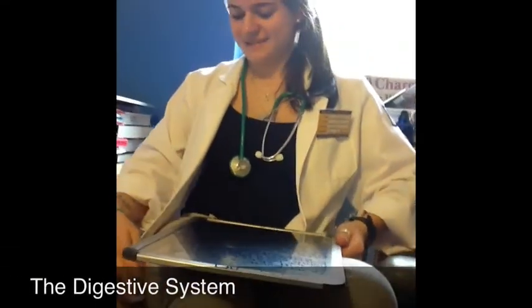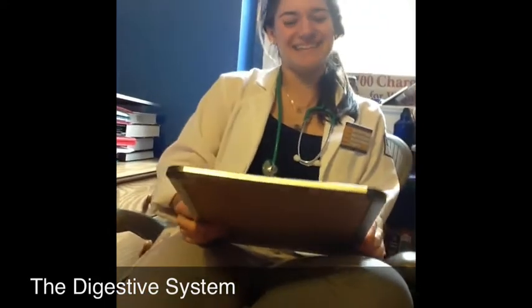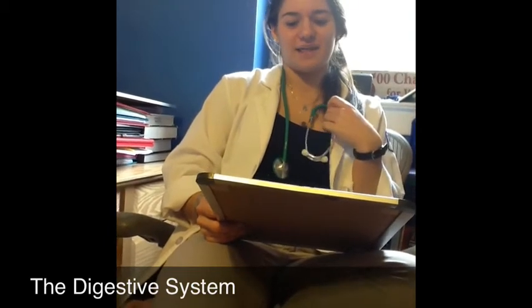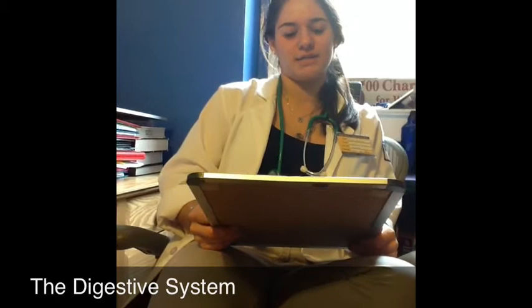Today we are joined by Dr. Isabel, who will tell us about the digestive system of our pig. In the mouth, there are several structures, such as the hard palate, the soft palate, and the tongue. Taste buds on the tongue allow the pig to taste salt, sweet, sour, and bitter tastes.